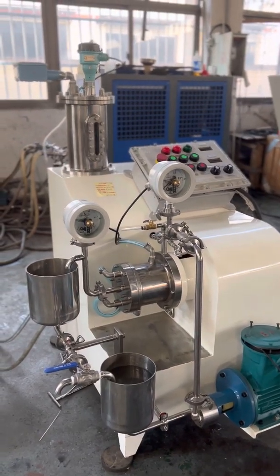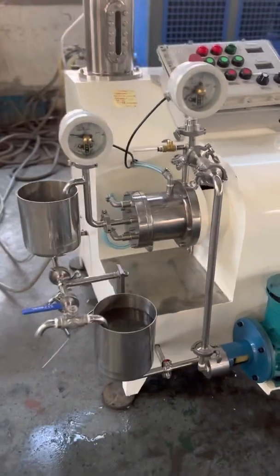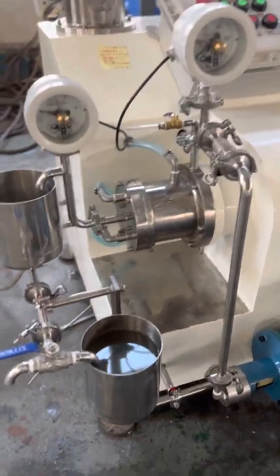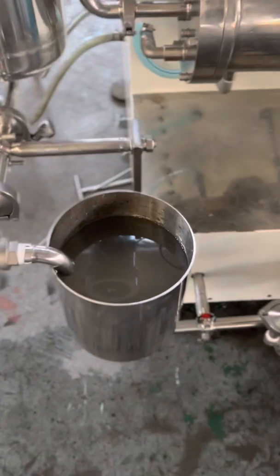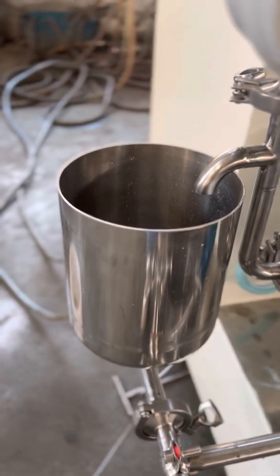Hello, this is the testing for the laboratory bead mill. Let me introduce the bead mill first. This tank is for feeding and this one is the receiving tank.